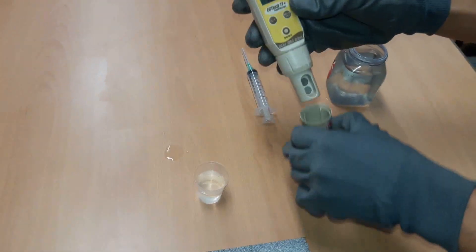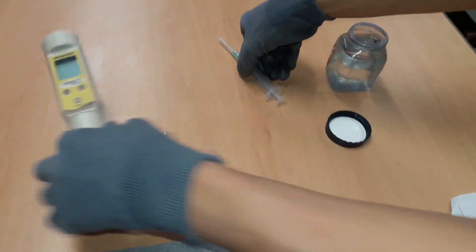Fill the syringe with 3 milliliters of solvent or one quarter of the solvent contained in the beaker.